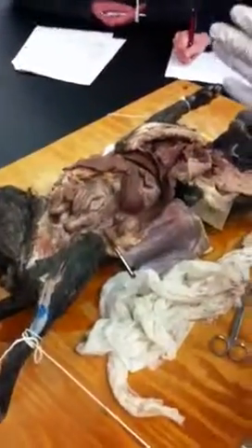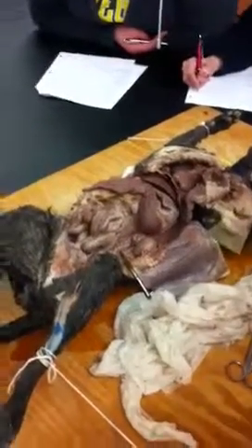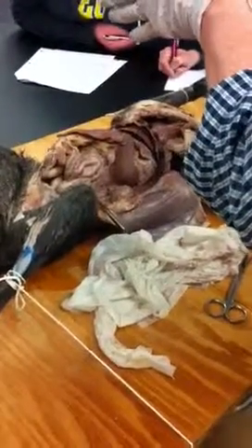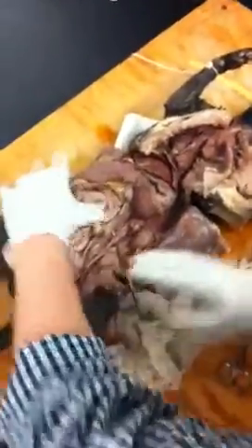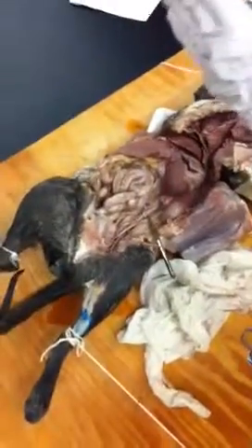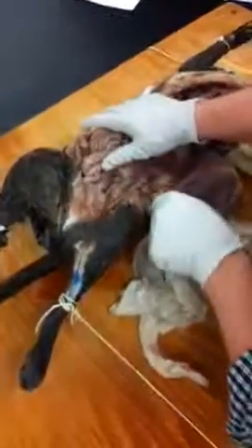When it gets down into the inguinal area, it then terminates or ends, and it ends in the iliac arteries. The iliac arteries are in the inguinal region, and they go from there and change names, and they go into the legs and become the femoral arteries. Okay? So we'll look at that. This actually shows up reasonably well in this specimen. Does that have something to do with being close to the iliac part of the bone? Mm-hmm. Yeah, because the split is usually in the upper part of the pelvis, so right around the iliac, or the ilium, I should say.